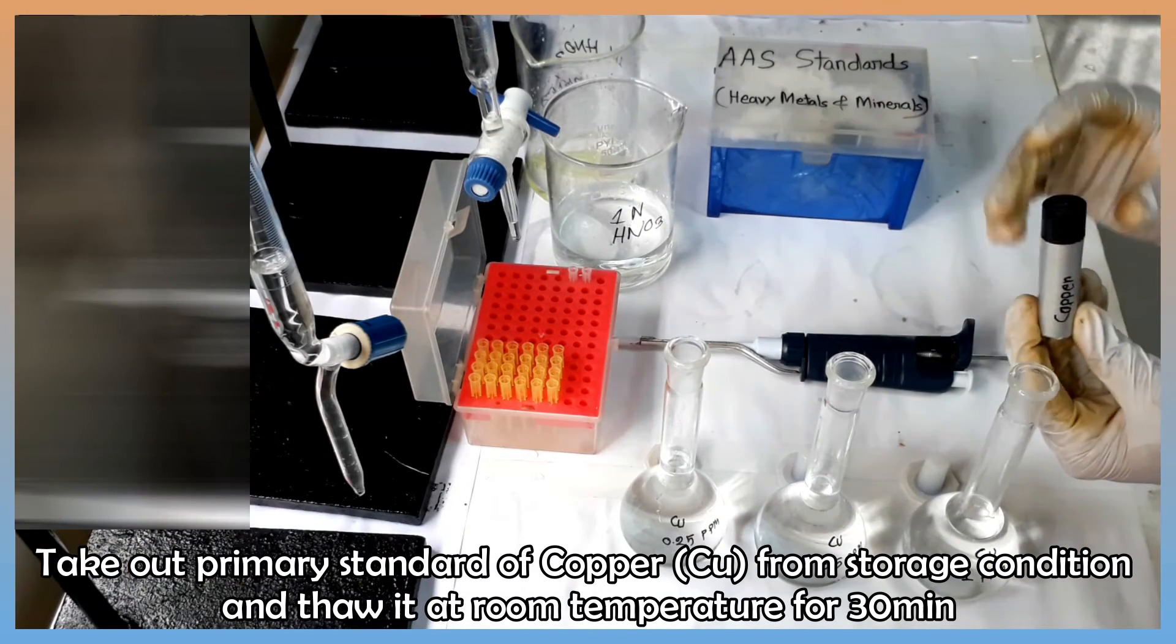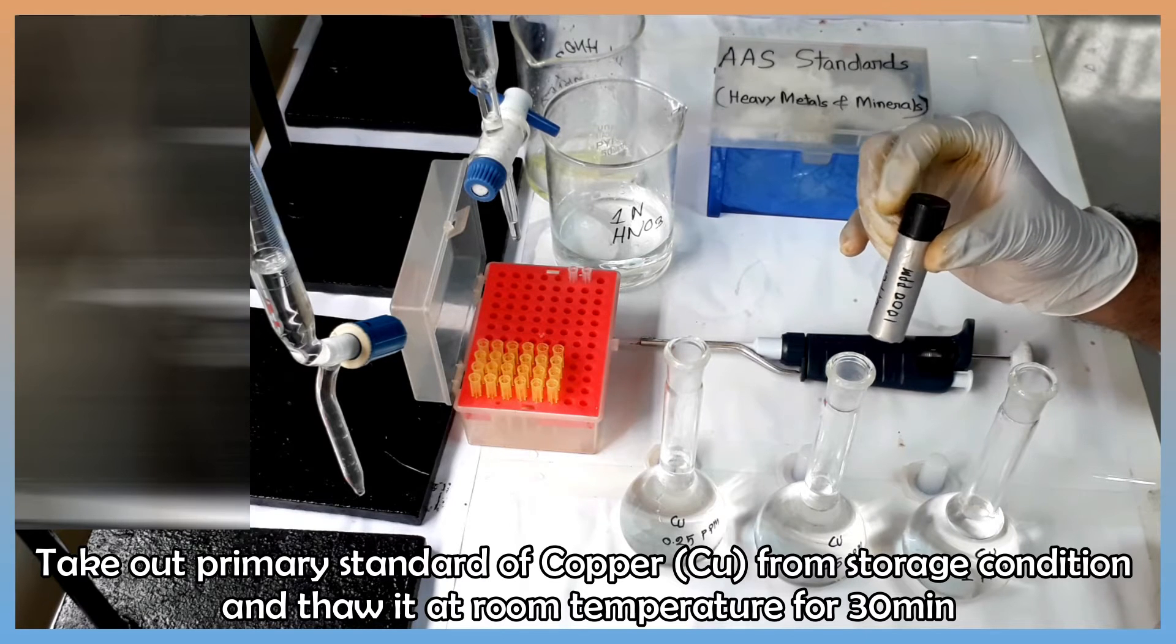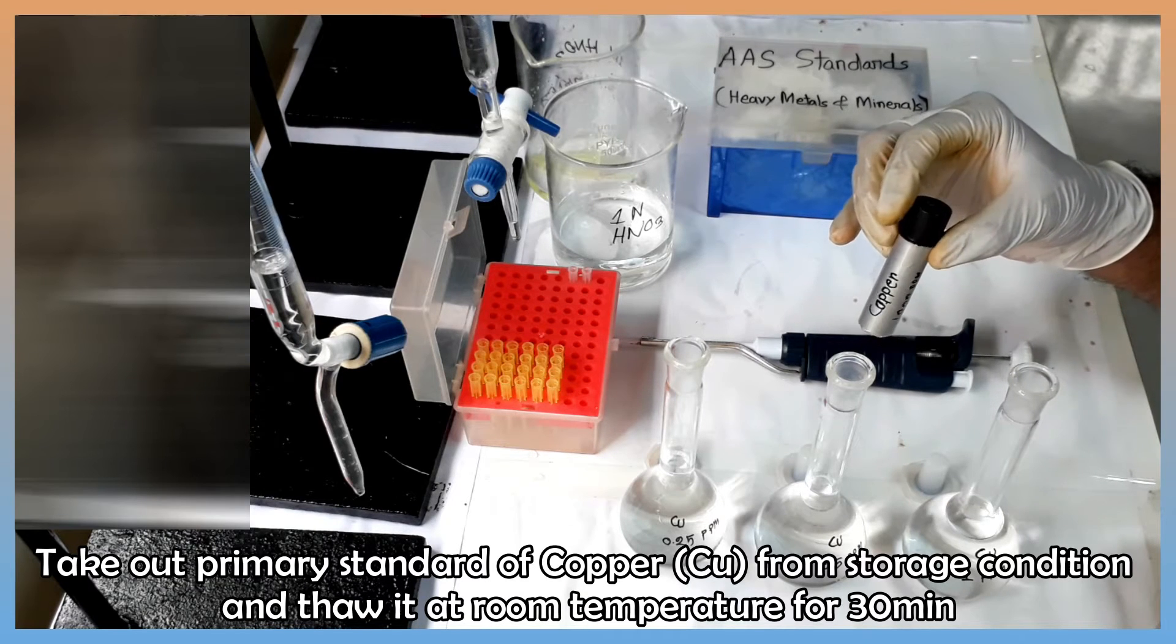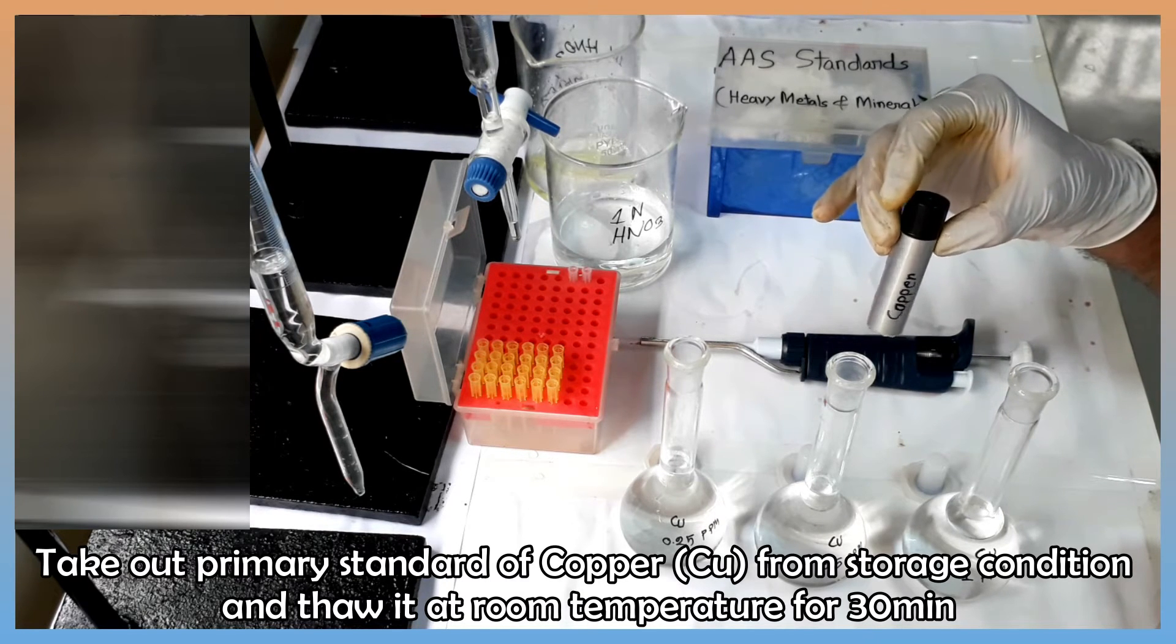We have copper primary standard of 1000 ppm. Take out the primary standard from the storage condition and thaw at room temperature before use.